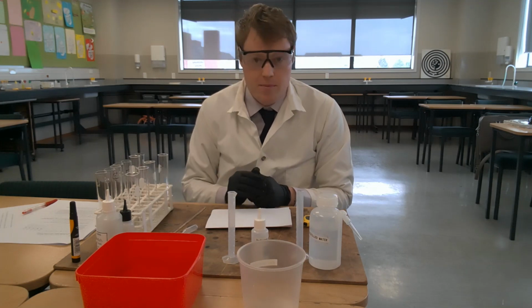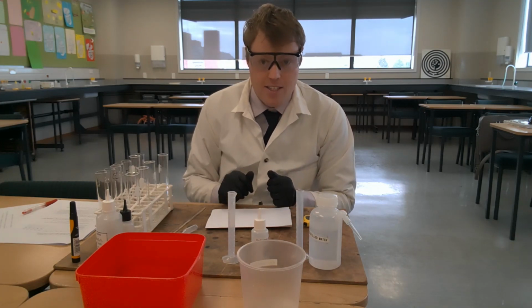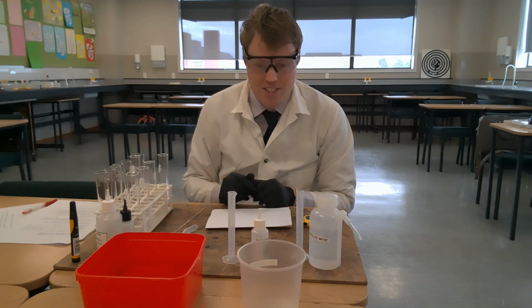Now, we're only completing one trial for each test tube. We have done that, so you have the data you need to do your results table and your graph and your analysis. So good luck with that. Enjoy the rest of the examination.